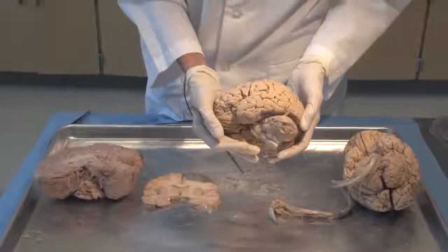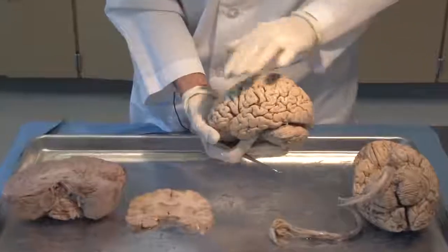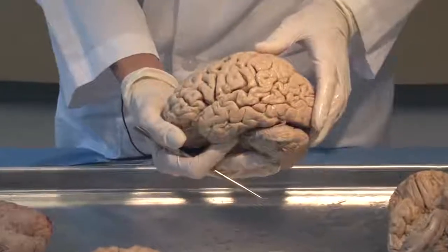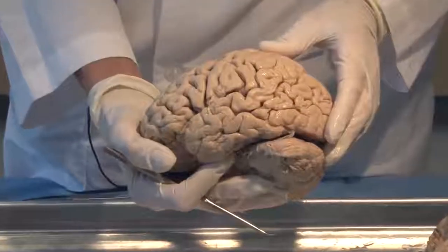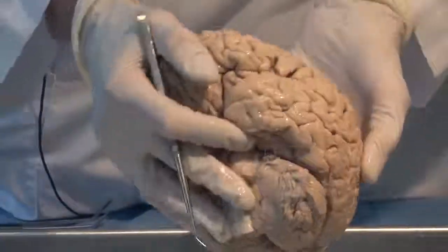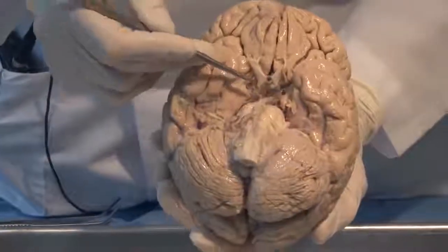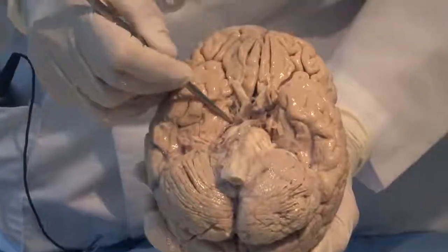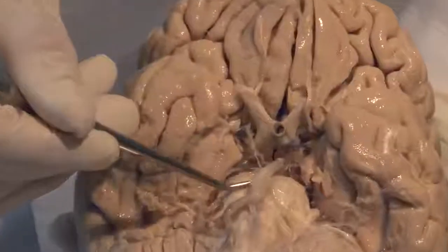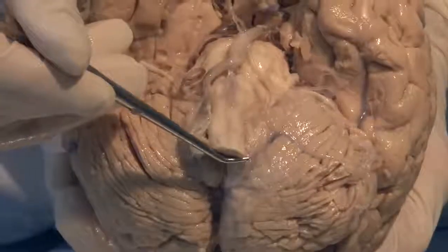Now let's look at the surface of the brain. We've removed the coverings, the leptomeninges, the pia, and the arachnoid, and I want to just show you the different lobes of the brain as an introduction. In addition, on this brain, you can see the brainstem. The brainstem extends from this region where my probe is, a little bit difficult to see, down all the way here to where the spinal cord was attached.